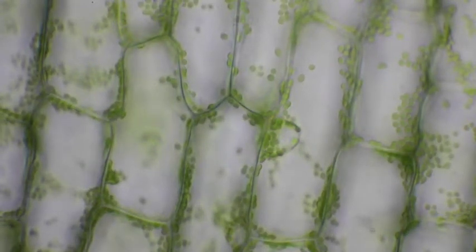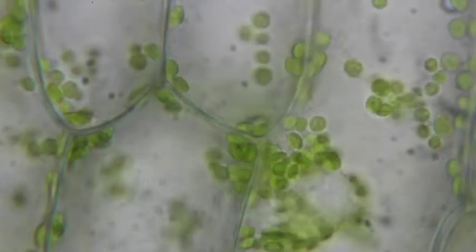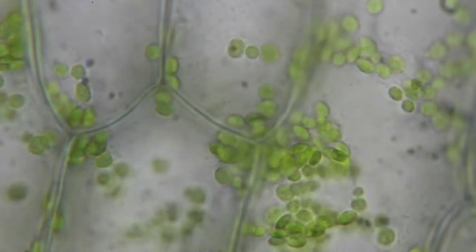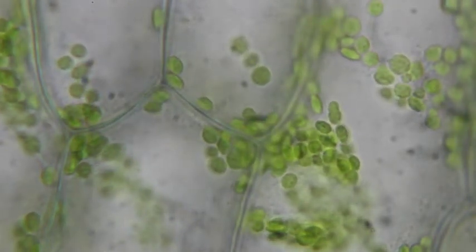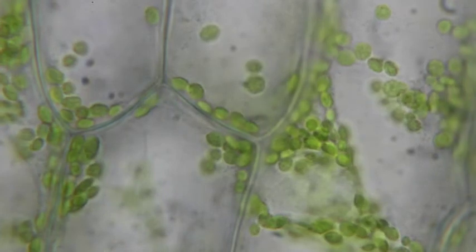Now I'm going to go under oil immersion. I'm going to switch between the 40x and the 100x objective, put a drop of oil right on the slide itself, and wheel in the 100x oil immersion objective. We can see the nucleus up close — that's a nice view of the nucleus. There are also little tiny dots in there the size of bacteria, way smaller than the chloroplasts — those are mostly mitochondria. So we can see: cell wall, cell membrane, chloroplasts, nucleus, mitochondria, and central vacuole.